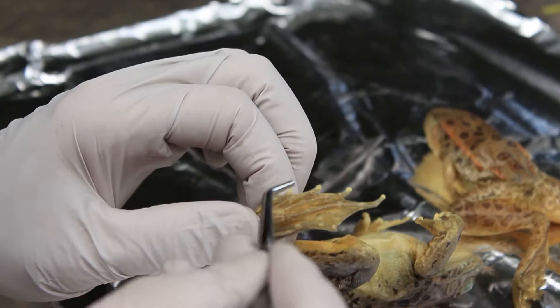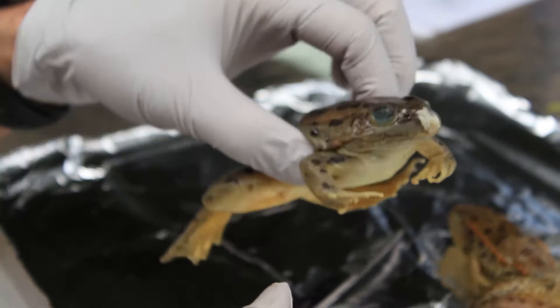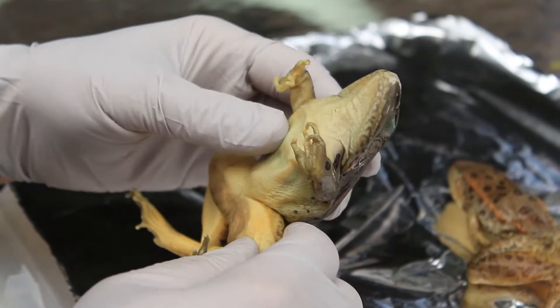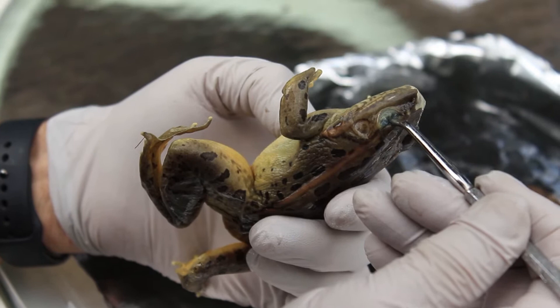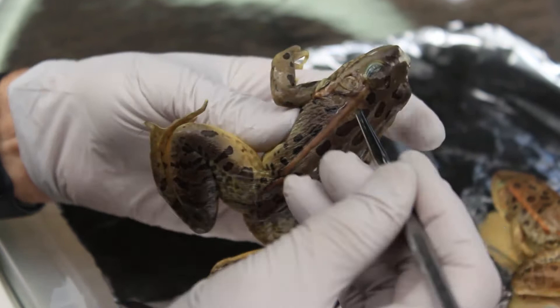The back legs are a little different — they have five toes. And their feet are webbed, which allows them to swim better in the water. If we look at their skin, a frog usually breathes through its skin, though it does have lungs — we'll see later on what those look like. This is called a leopard frog. You can see because of the leopard skin on it. It also has what's called the ear — the tympanic membrane — and an eye with a nictitating membrane that allows it to see underwater when swimming.